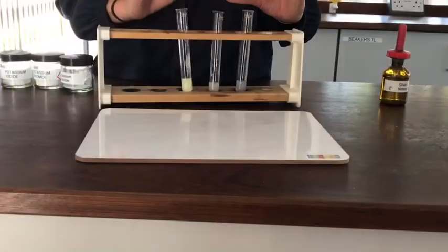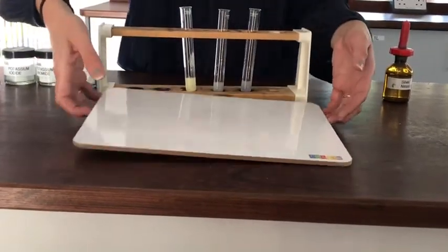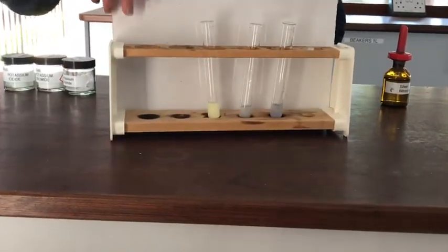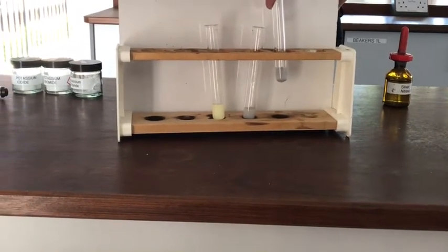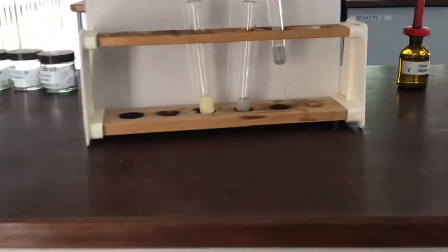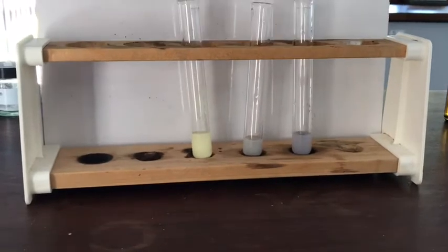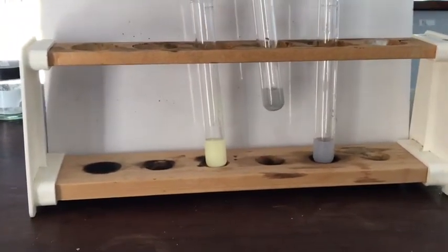So I've been out in the sunshine with these and brought them back in. I hope you can see that they are different colours. I'm just going to stand this white board behind them and I hope that makes the colours a bit easier to see. Okay, now these silver salts used to be used in old photographic films because they're so light sensitive. I don't know if you can see, this one was white and it's gone, well, we describe it as lilac, the colour on that. Okay, this one, this is, I think, a hilarious name for a colour, it's called buff.